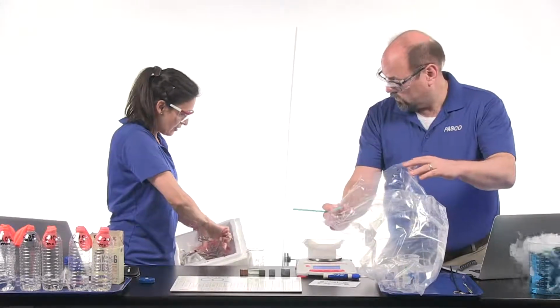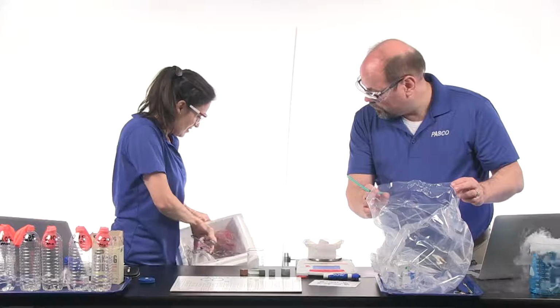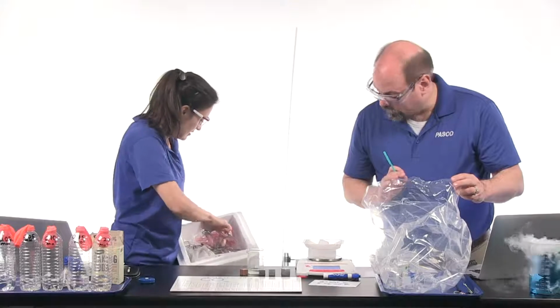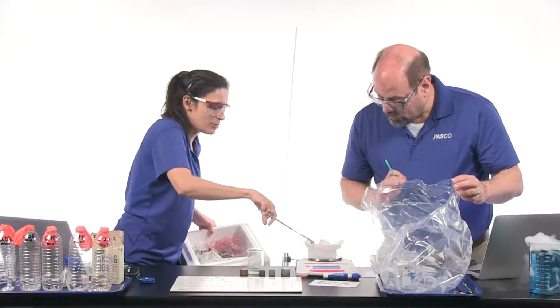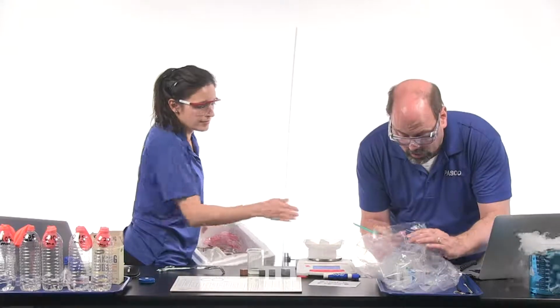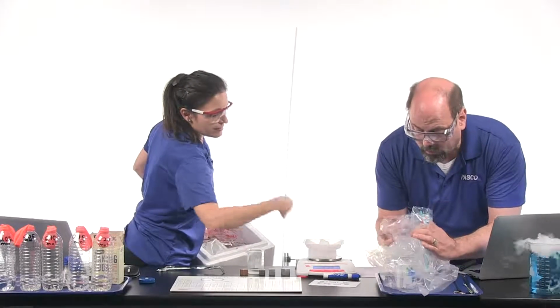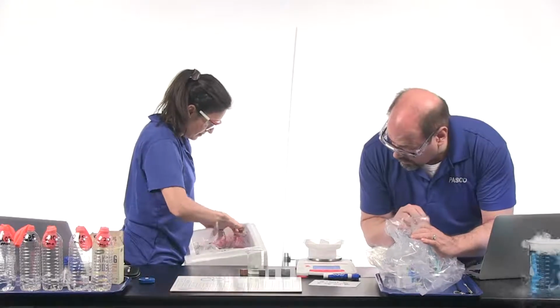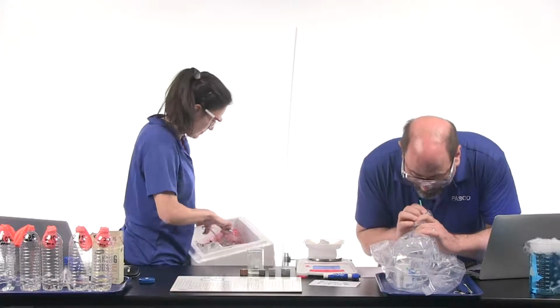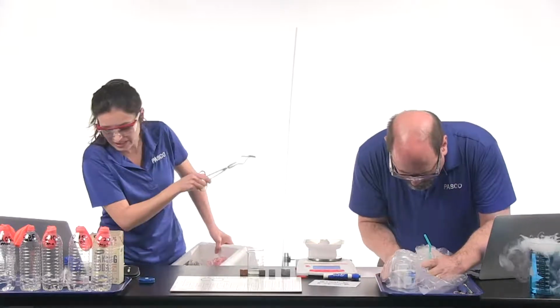Perfect. Okay, so I'm going to get another about 44 grams in here. Okay. Ooh, 40 grams. Close. You can start taking the air out of the bag while I perfect the mass. Ooh, that's really good. Maybe I'll swap this piece for that. Go ahead and pull the air out. Okay. Let me get down to low just this way. We'll close the straw off in here. Okay, and I'm still trying to get that perfect 44. I got about 45, so I think I'm happy with that.